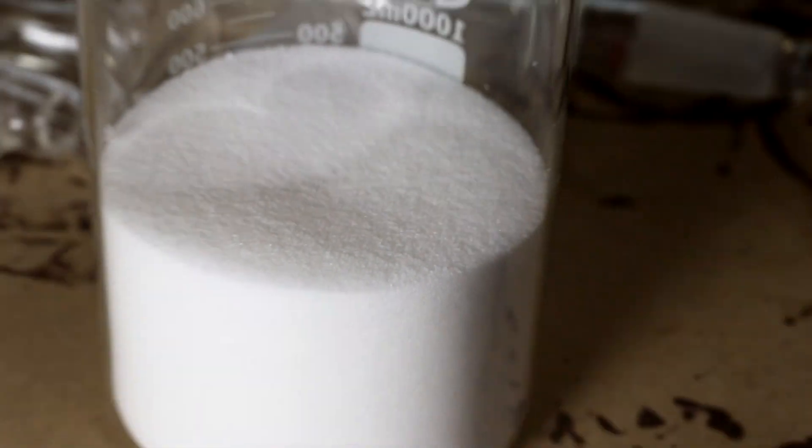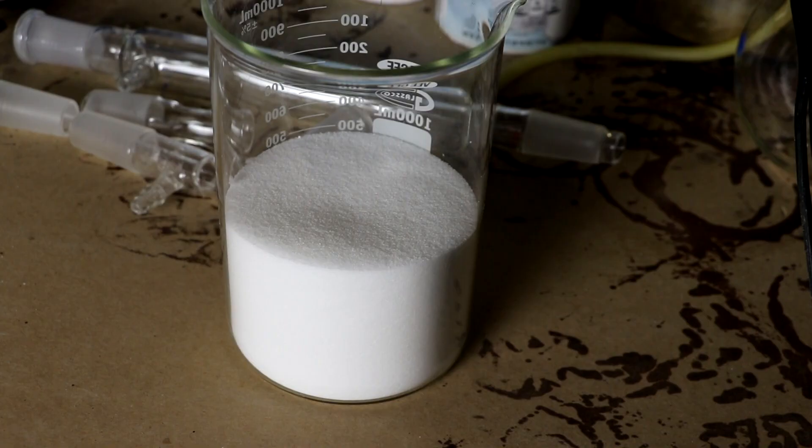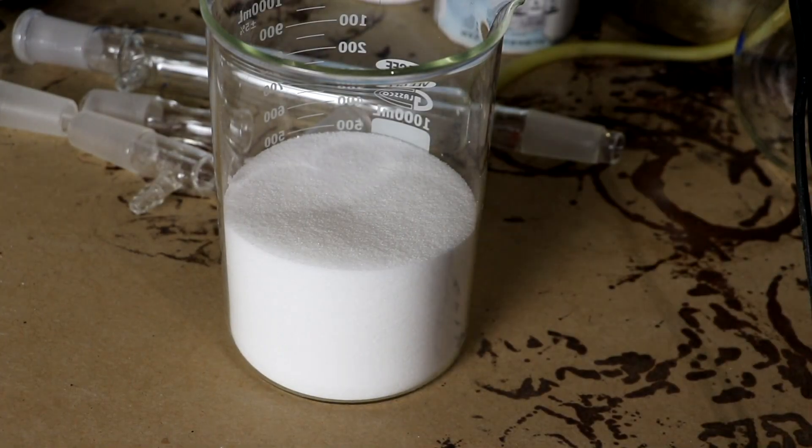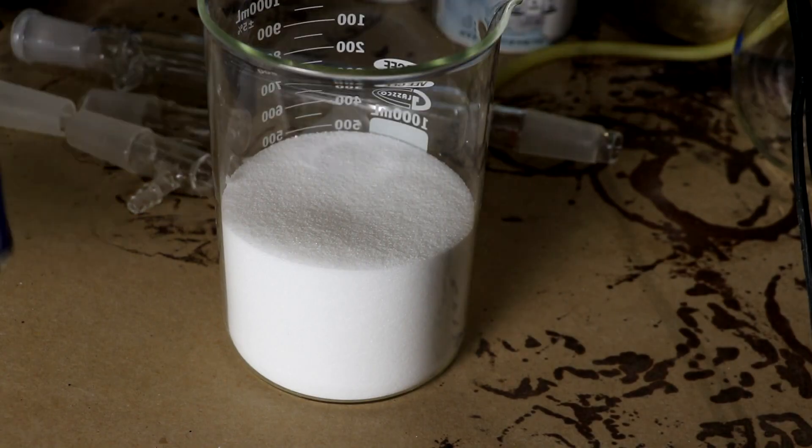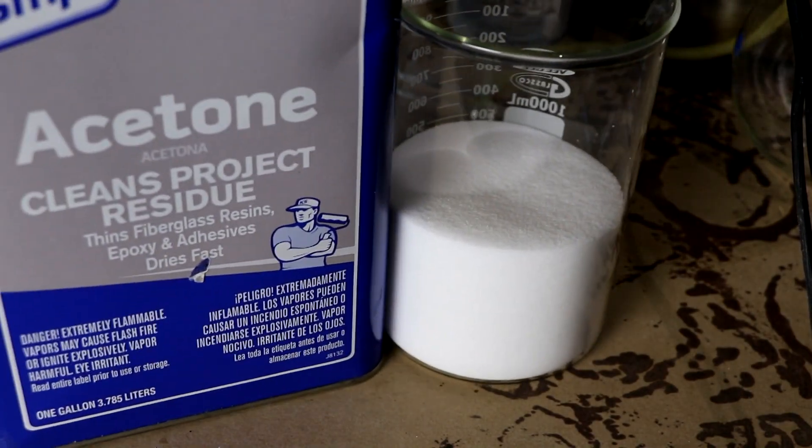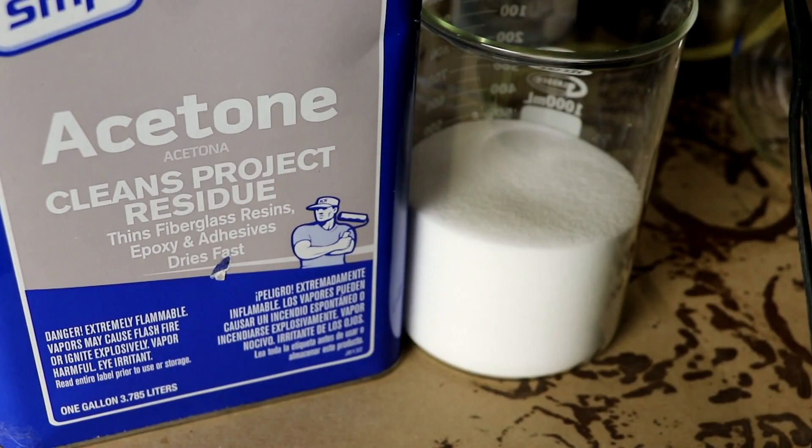Now, you could do that with water. But that would be really hard because then you'd just end up with a solution with a bunch of salt in it. So, let me use something that does not dissolve salt, but will dissolve the iodide. Sodium chloride, almost completely insoluble. Only maybe a few milligrams will dissolve in a liter of acetone.